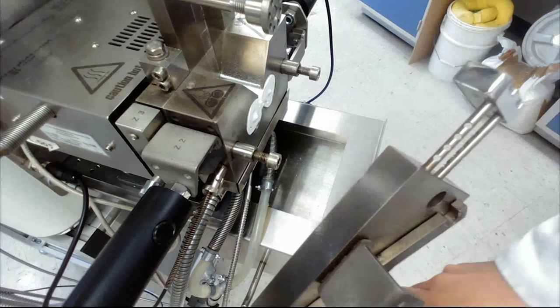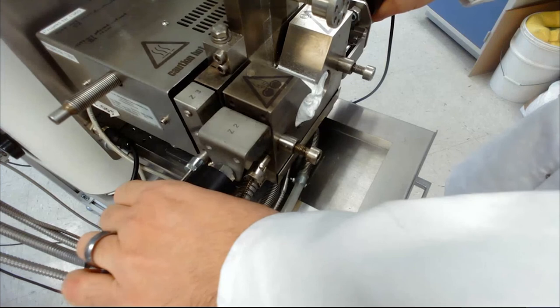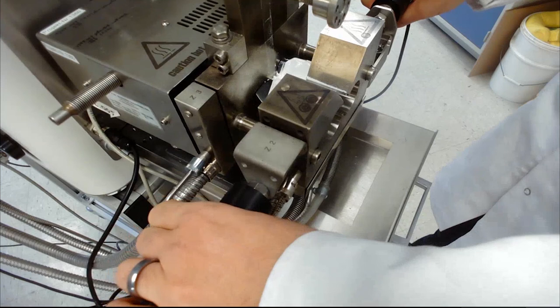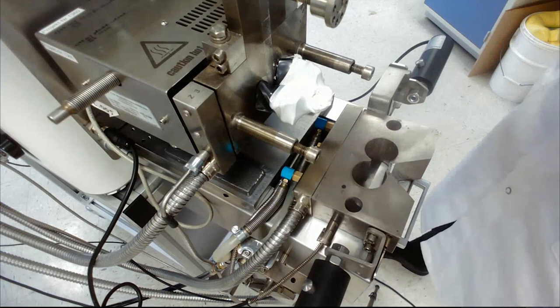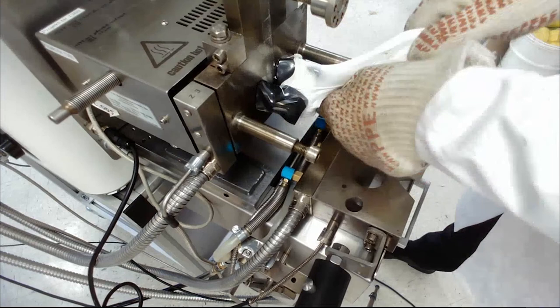The new feature is that we have two hands that we can press and it will activate the jog. So as I'm pressing it, without being in danger of putting my fingers in, I can move the bowl and have an easier time discarding the material. Then we just simply go in and remove the material. Beautiful vinyl formulation, perfectly white and very nice because it doesn't stick. Here's our sample and then you can just roll this out or do other tests with it, but the most important part is the data.